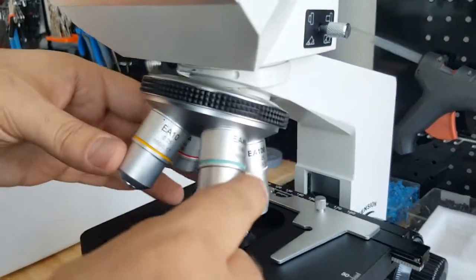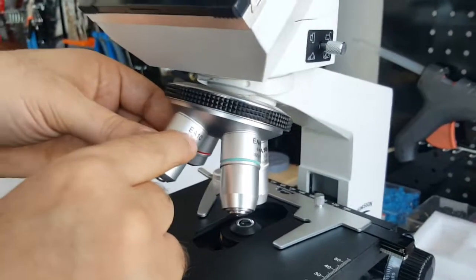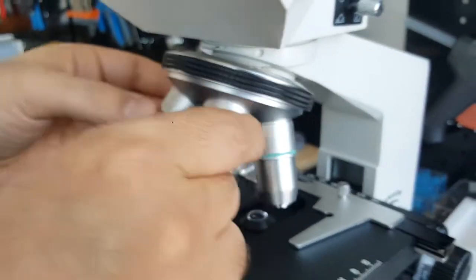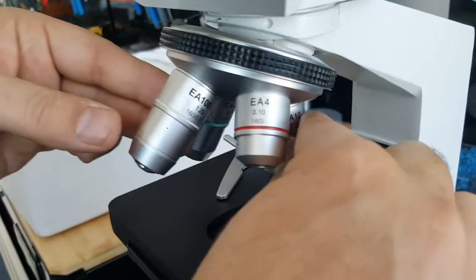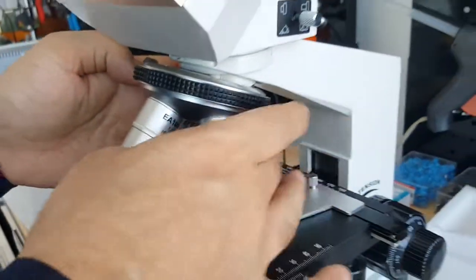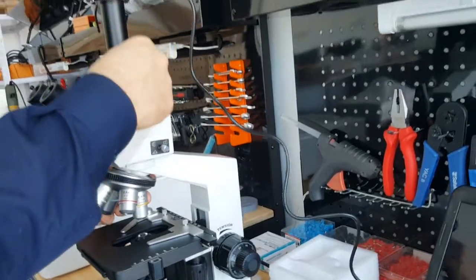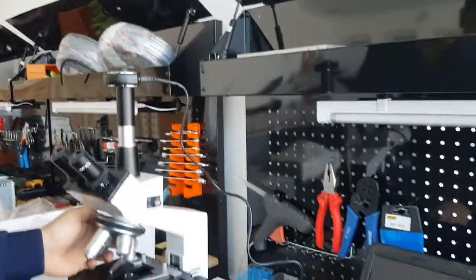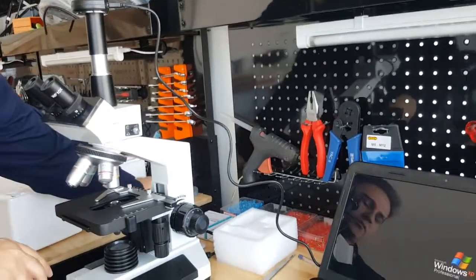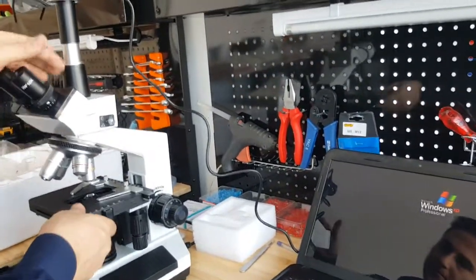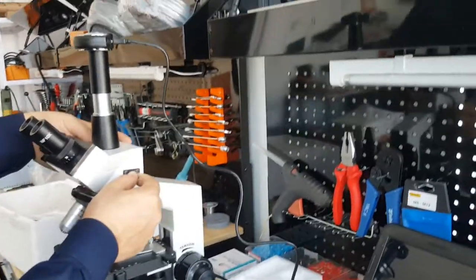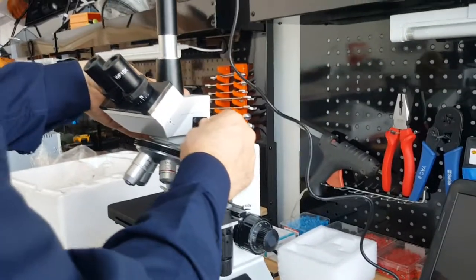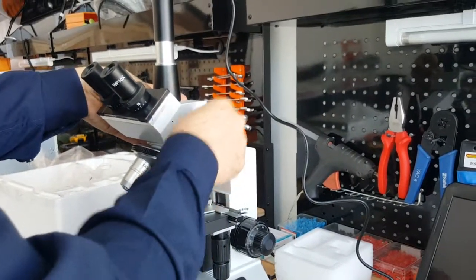You see which one is 10 here. This one is with magnification of 10 and it will give us 10 multiplied by 10, or 10 multiplied by the CCD camera that is 10, which gives us total magnification of 100. And we also have a cover here for the third eyepiece.